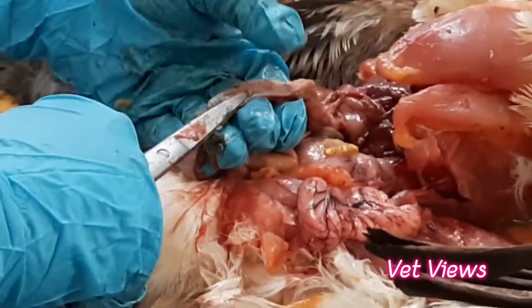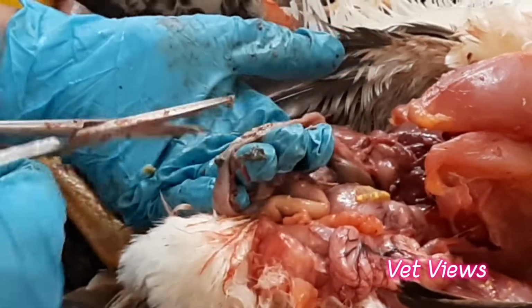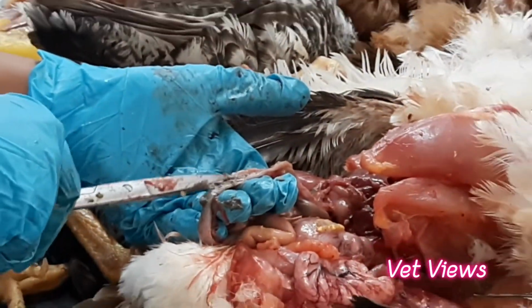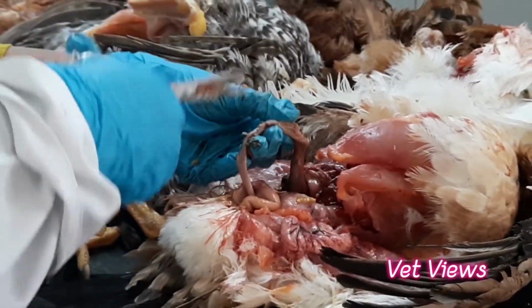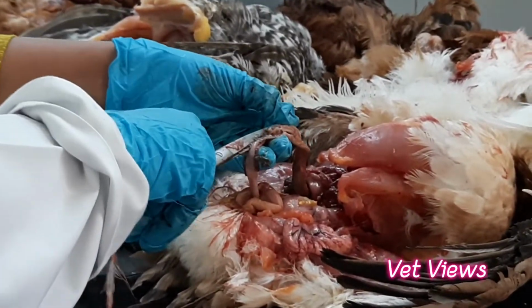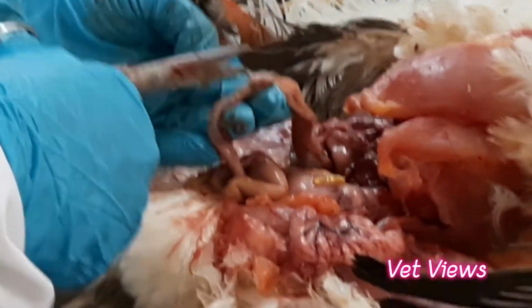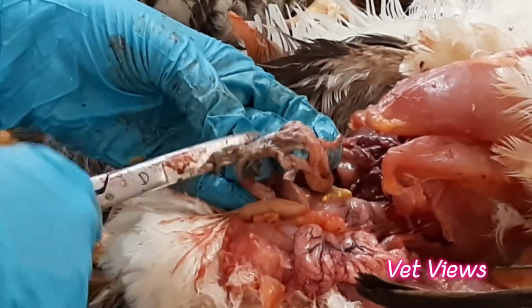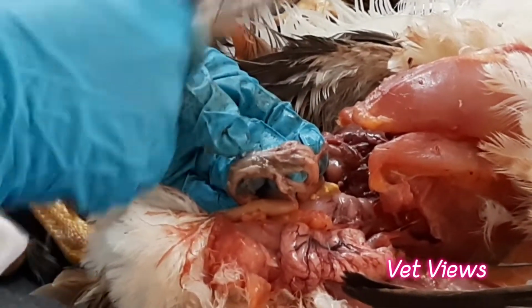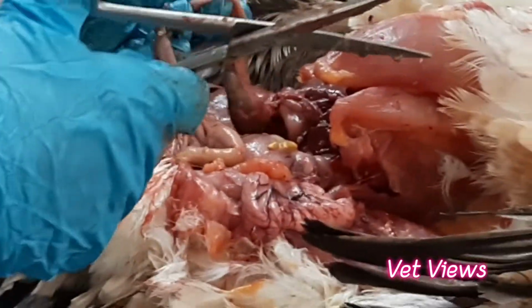Small dots are there, no? This is normal actually. When there is a hemorrhage, there will be too many hemorrhages, so red dots you are able to see now. This is not swelling actually. Swelling generally we don't find when there is infection. It doesn't happen. It becomes hemorrhagic. It becomes very thick and a lot of blood will be there in this organ. Okay, now it is very clear. When small dots are there, it becomes very prominent when severe hemorrhages are happening.